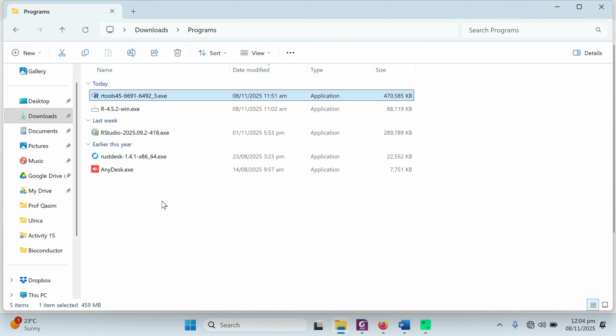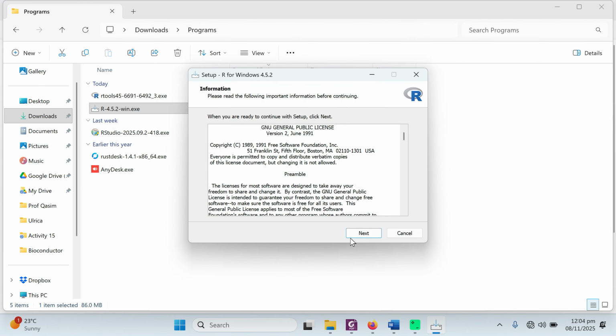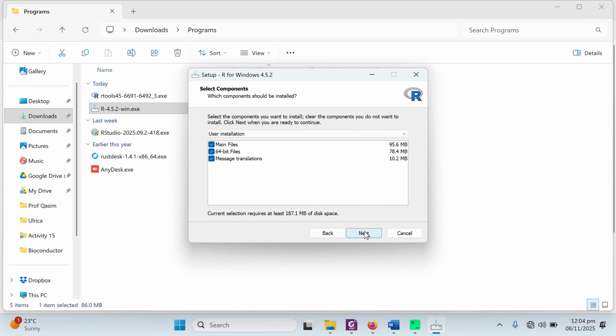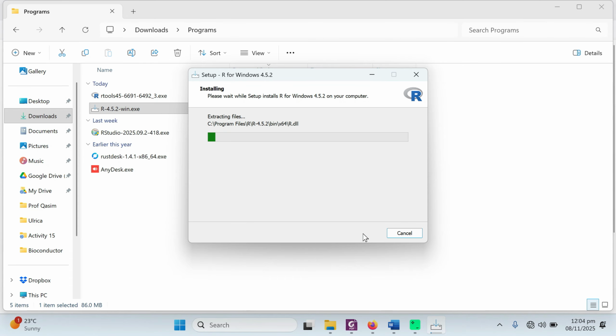Now we have downloaded three tools: RStudio, R and RTools. You need to install them one by one. First of all, you need to install R. Just double click on it and it will start installing. Click on the OK button. Click on next. It will ask you the path where you're going to install it. Click on next. Next. It will choose the default path, install, next, and it will install your basic R package in your system.